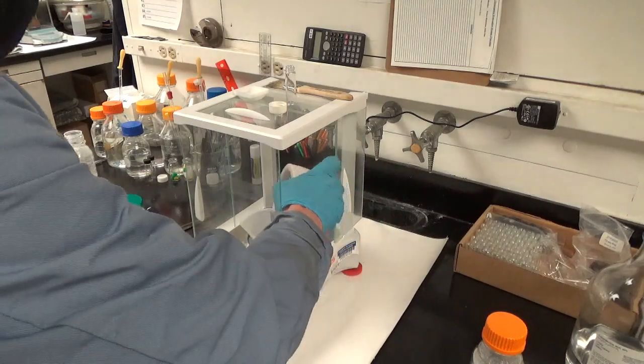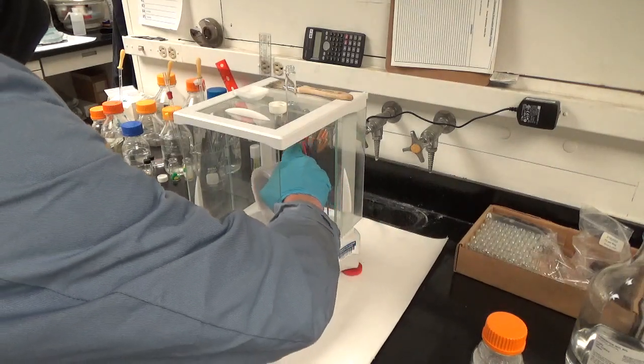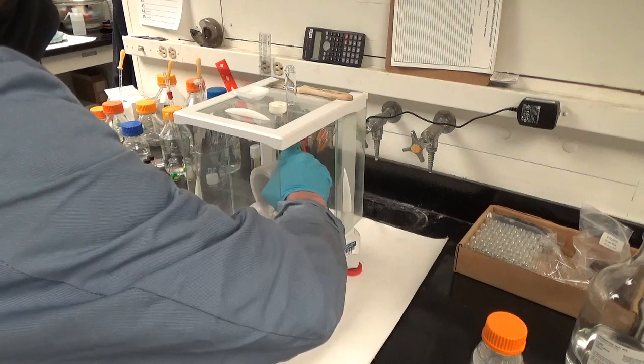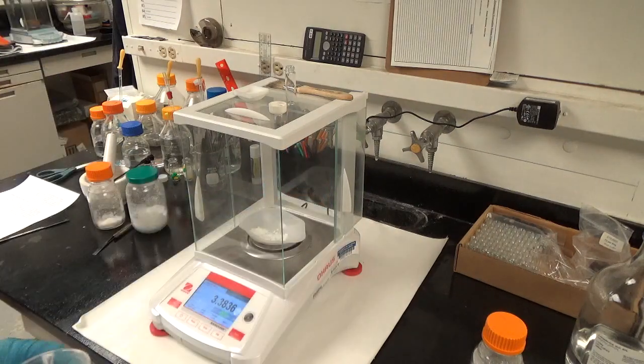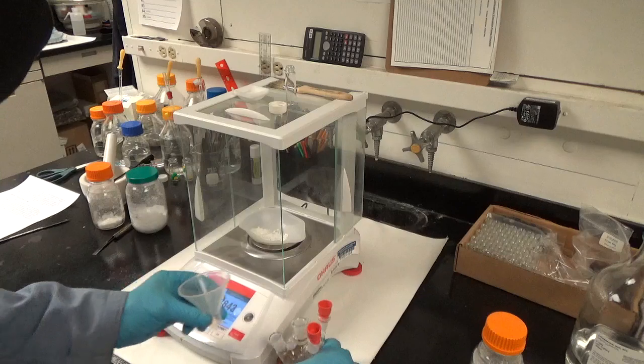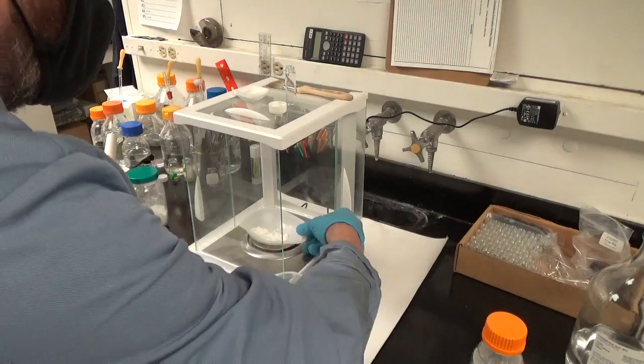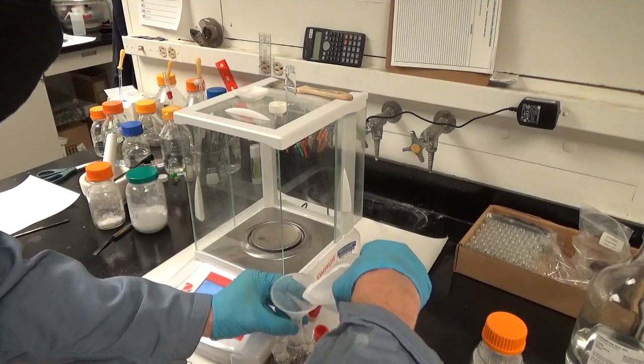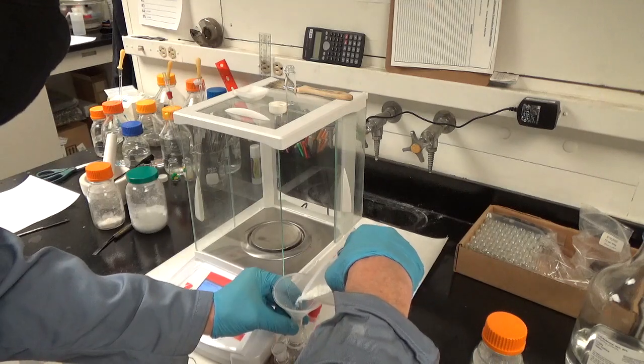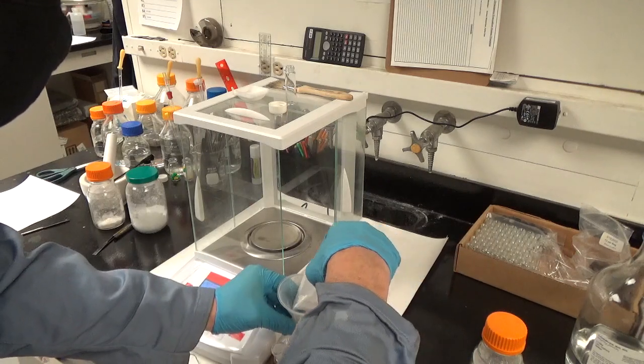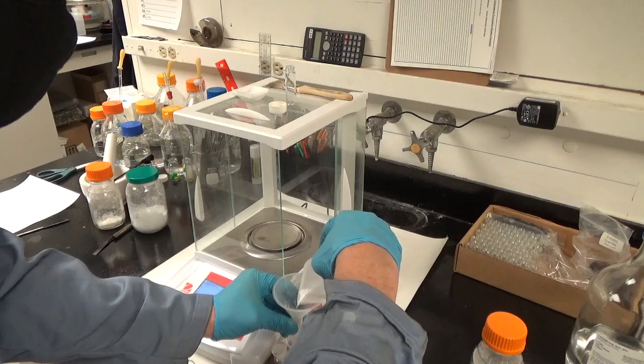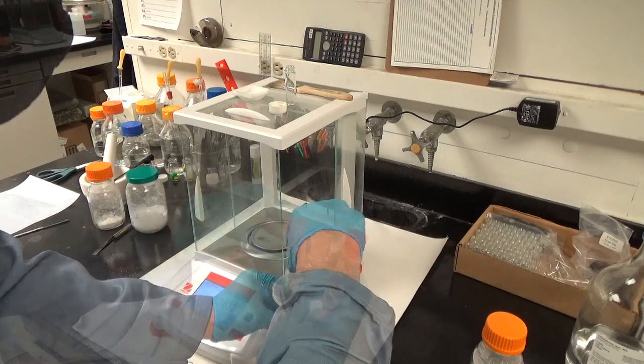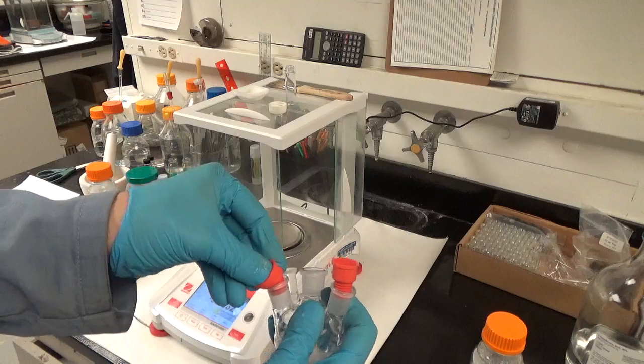What I'm doing there is not very smart, using the mortar to pour into the weigh tray. I cannot be accused of having perfect experimental skills. One of the reasons you really got to powderize it is that you got to get it into the four-neck, and that's actually kind of difficult. It's tempting to try to get it into tiny chunks, but if one of them gets stuck there, good luck.